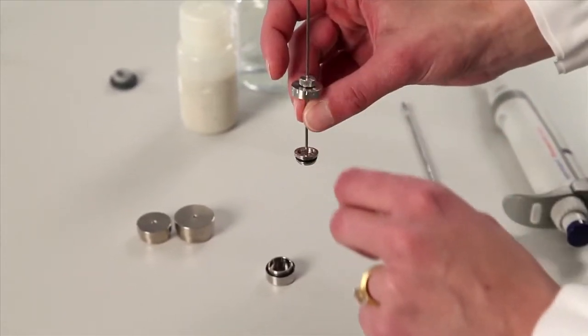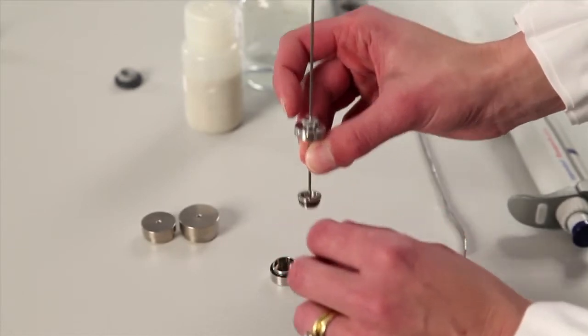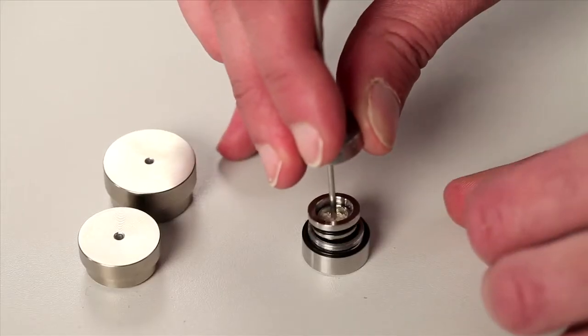Care must be taken at this point, so we don't introduce the solid up on top in this upper chamber into the liquid down in the bottom in the lower chamber.